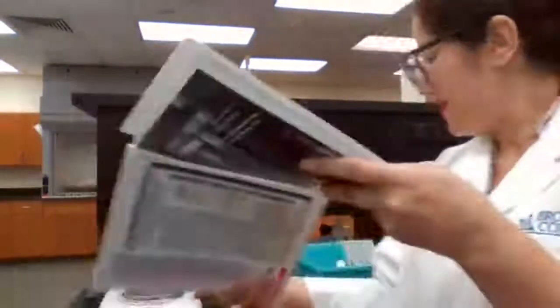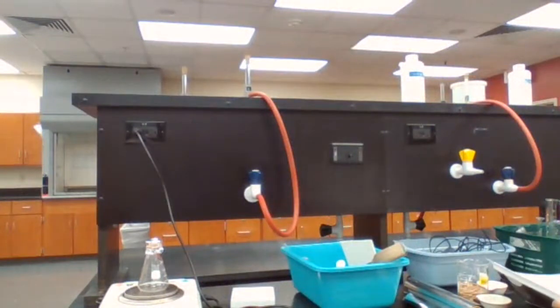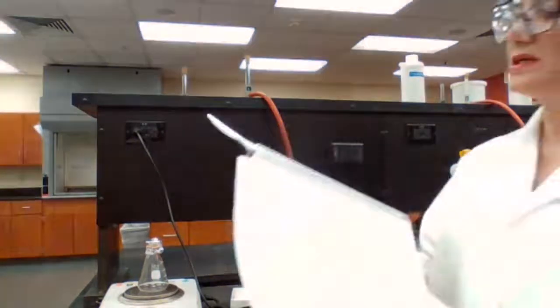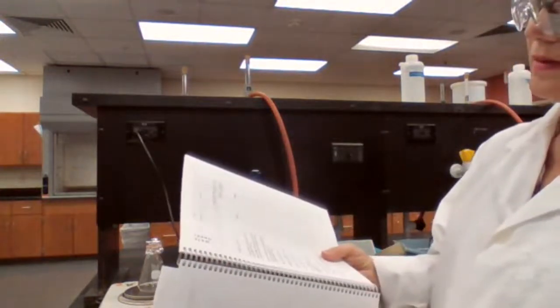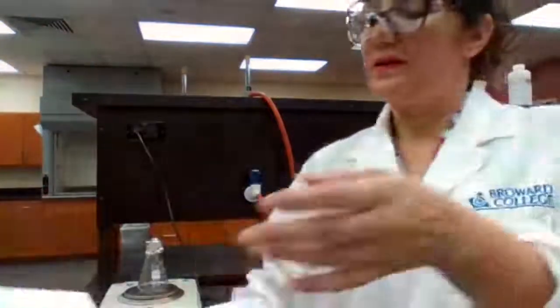And in your report, that mass goes to the report sheet. Let me see what the designation is for it. Well, there is no designation, so it's just the first item that you have there, which is the mass of the flask.